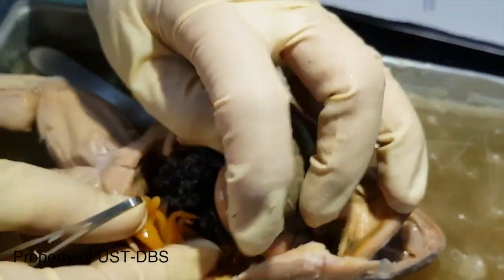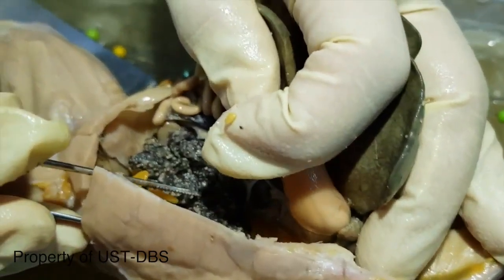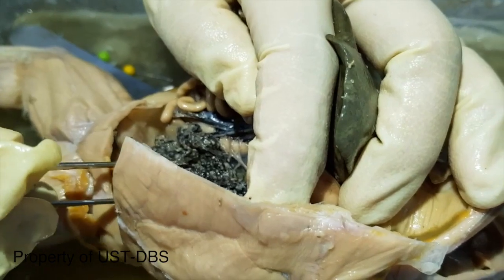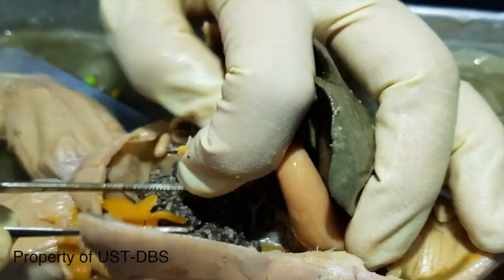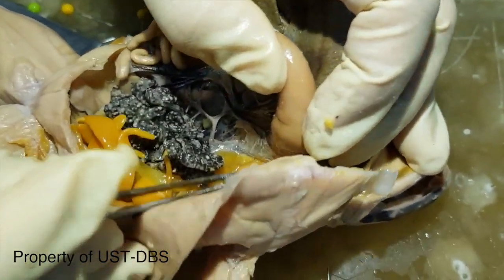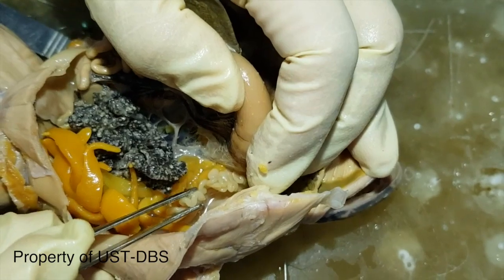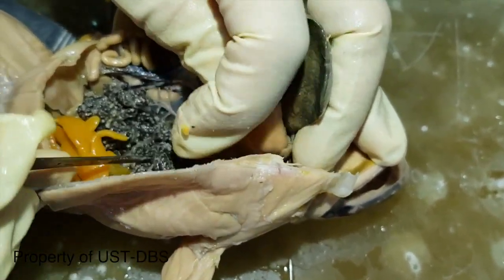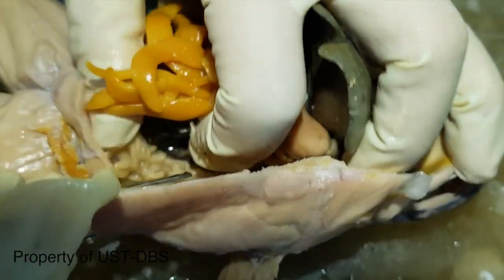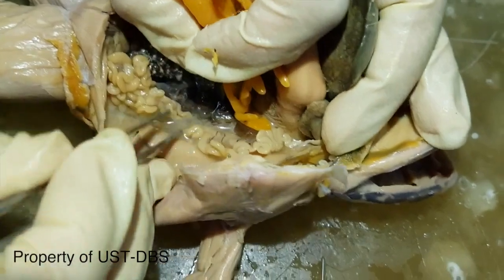These are actually eggs. This is a female, so these are eggs that are ready to be released outside for external fertilization. Then this whitish coiled structure is the oviduct. These are fat bodies. That's still the oviduct here.